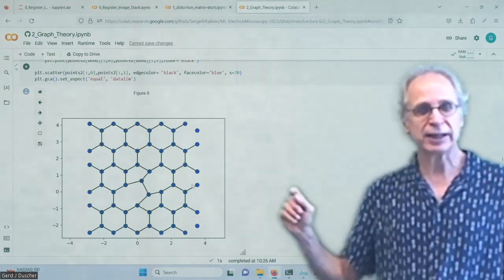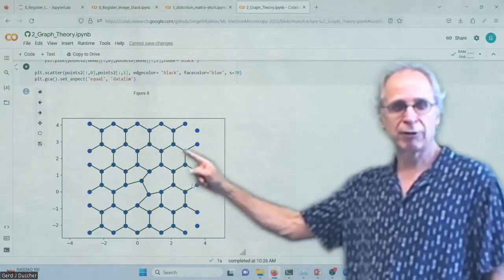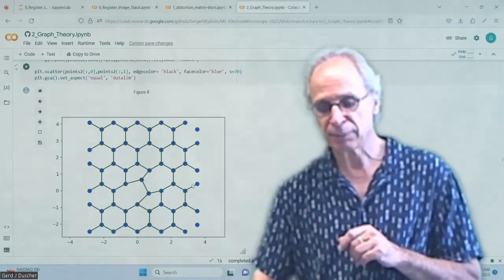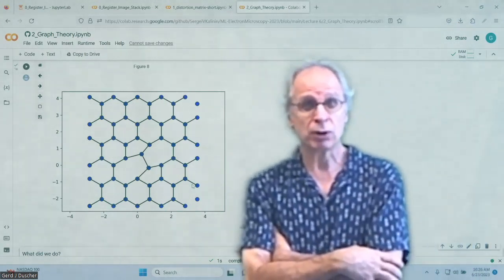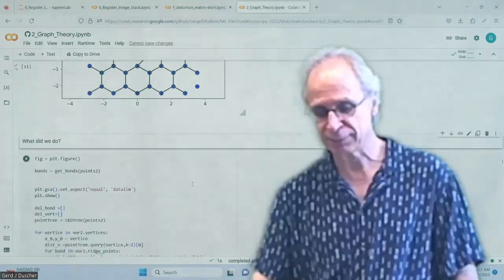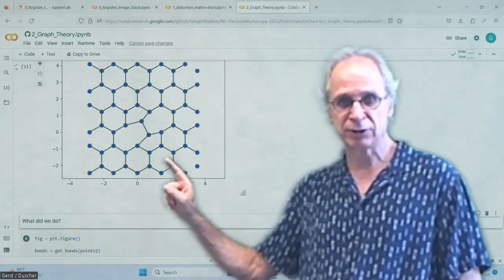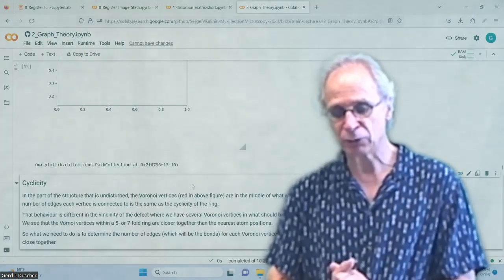And then I actually get the reliable bonds for that as well, because bonds are around the convex ring here. That must be my bonds in the projection, right? And so this is now a way in 2D or 3D to get bonds independently of how far away your atoms are. This is really nice. The theory behind it is relatively complicated. But you can make all of your crystallography based on the interstitials. So they are equivalent. But that would be going too far here.